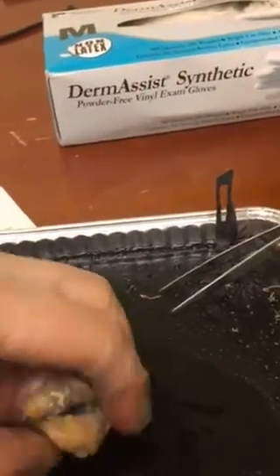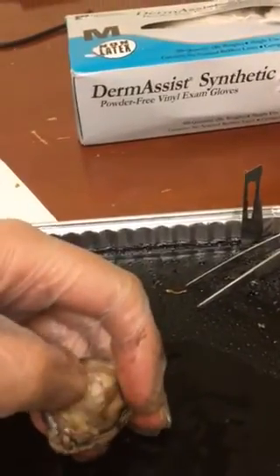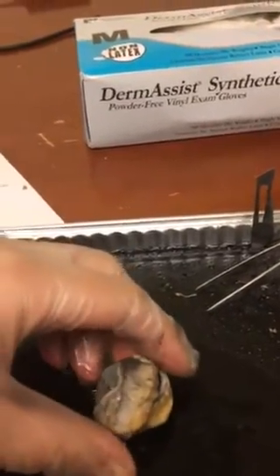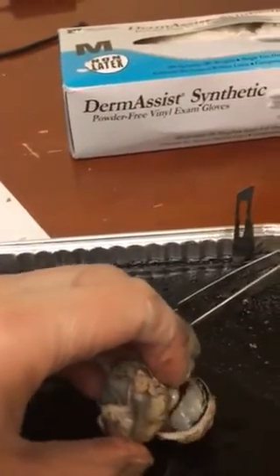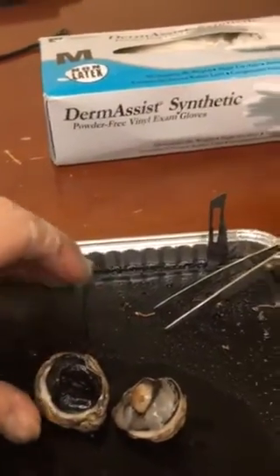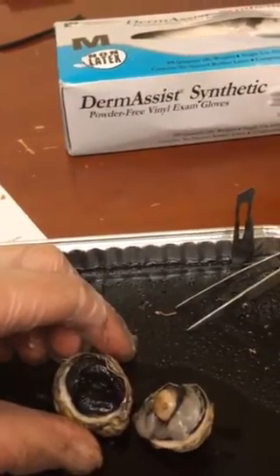And then over on the back, we have the optic nerve right here. And that's a bundle of nerve cells that sends signals from the eye to the brain. And as I made my incision, all the vitreous humor came out. That is a viscous fluid that fills the vitreous body and helps maintain the shape of the eyeball.